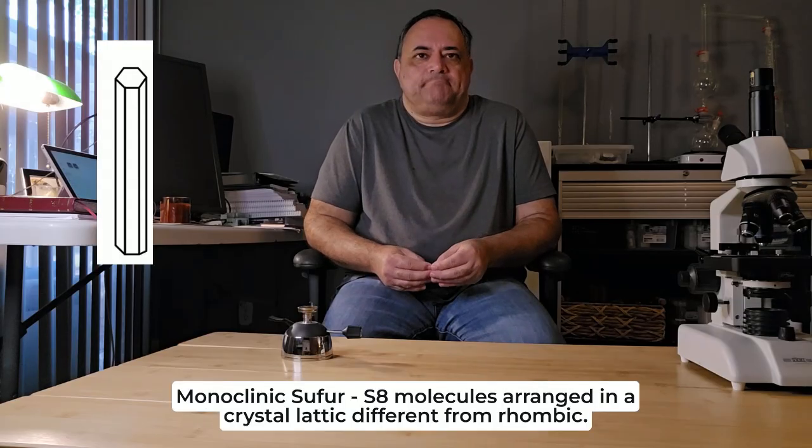We then heated the sulfur in a test tube until it turned a yellow-orange color, and we then filtered it and let it cool down. This formed monoclinic sulfur.